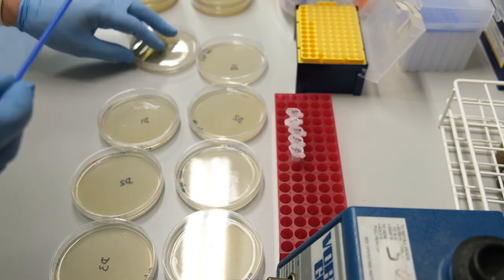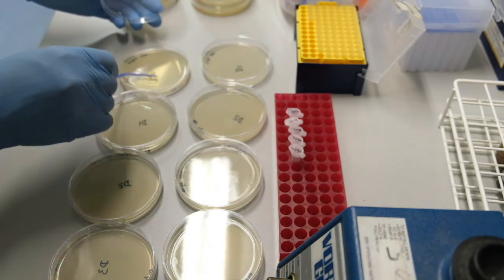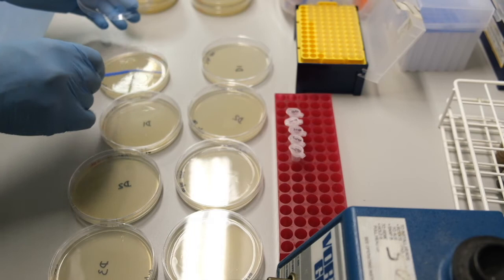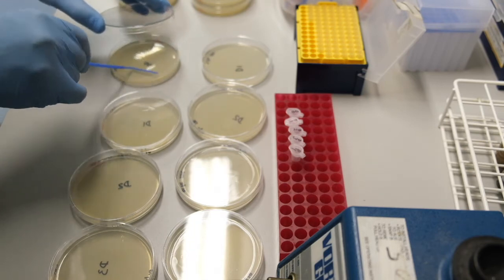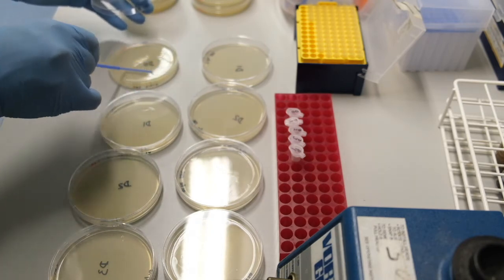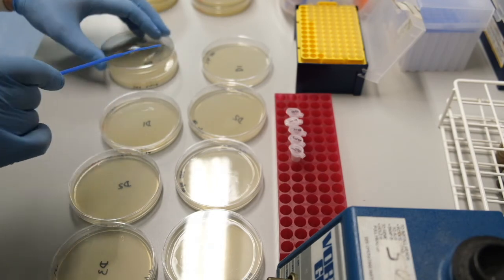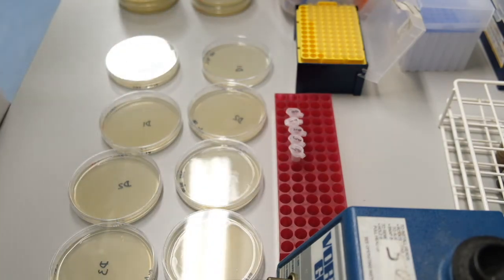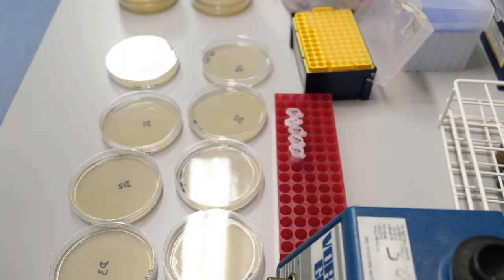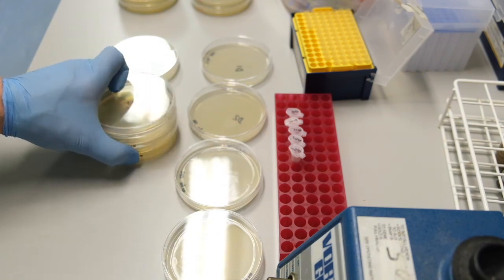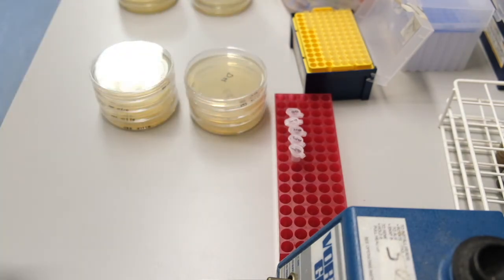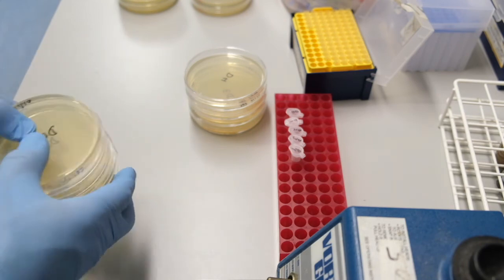I'm worried that I might have contaminated the spreader at this point, so I get out a fresh spreader and use it for the final plate. Stack up the plates, ready to incubate at 30 degrees centigrade. It will take up to a week for your Streptomyces to grow at this temperature.